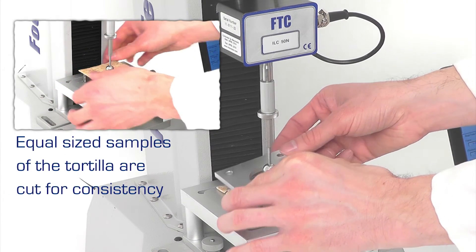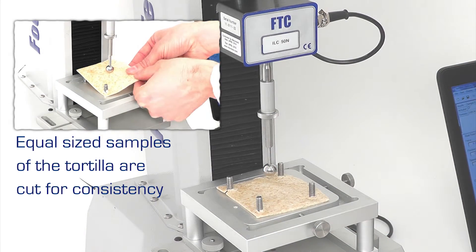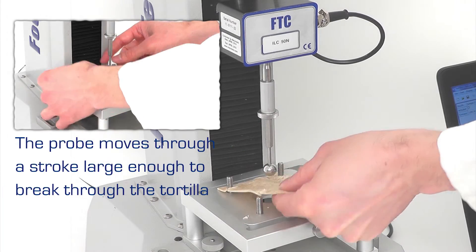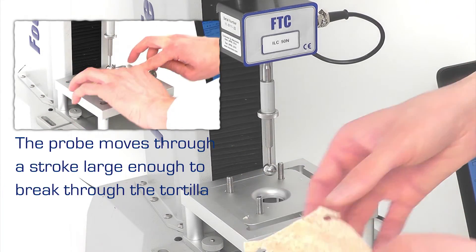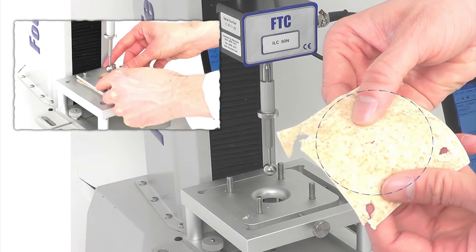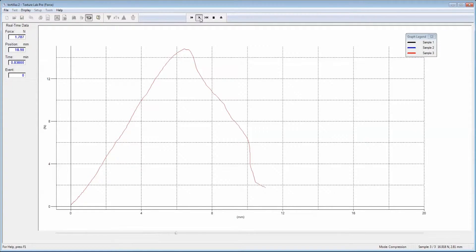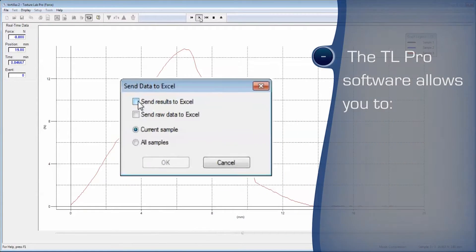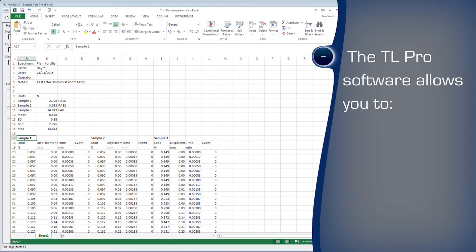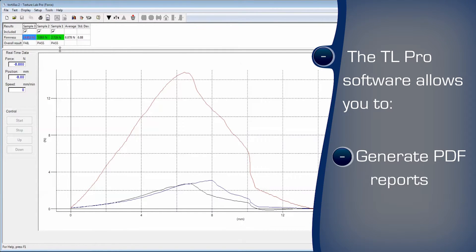Stale products would likely achieve a higher peak force at a smaller deformation and a noticeably different curve shape and area. Similarly, a whole wheat alternative can be compared to an ideally elastic recipe. The TL software can export to Excel for further examination and traceability, and format the results in a user-customizable report style.